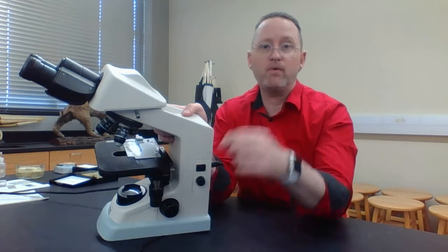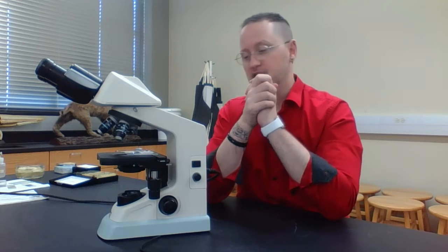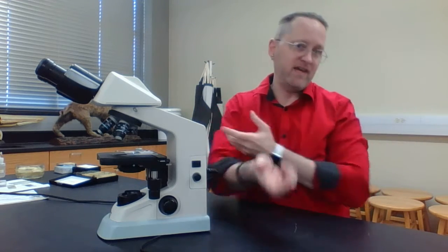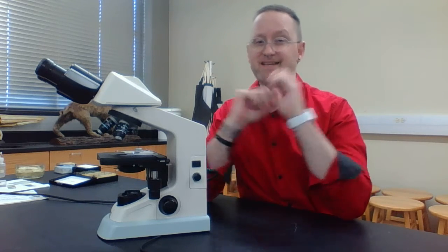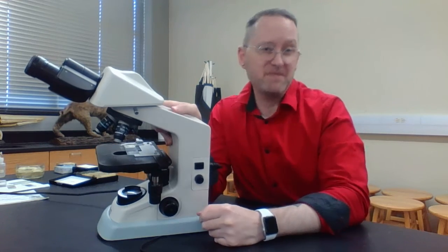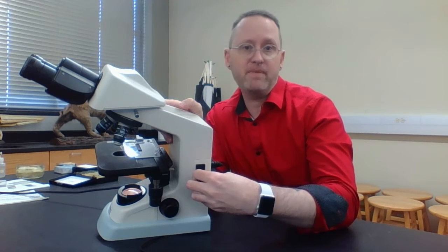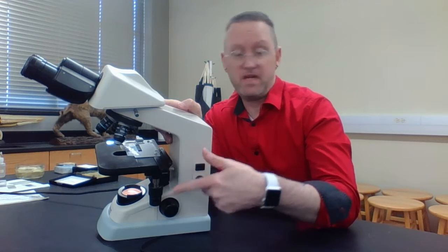One of the things I want to point out, which a lot of students get wrong, is when they turn on the microscope thinking, well, my light bulb is burned out. And a lot of times that does happen. The light bulb is burned out, and it's very easy to replace the light bulbs in here. But when you turn it on and you don't see any light, that doesn't always mean that your light bulb is burned out. Check the rheostat first, and sometimes it takes a couple of seconds. So if you look at this, I'm going to twist it up. It's still not on. It's still not on. It's still not on. And bam, it's on. So again, make sure your rheostat is adjusted so that you can actually see the light.